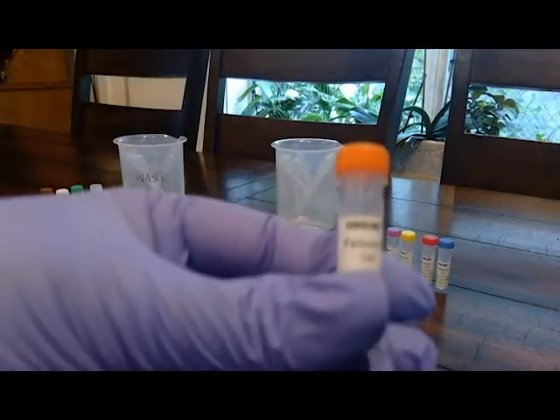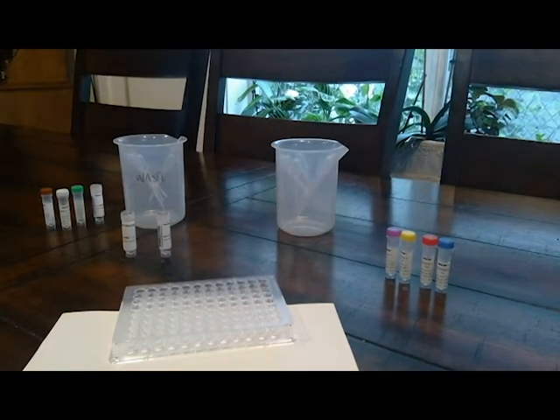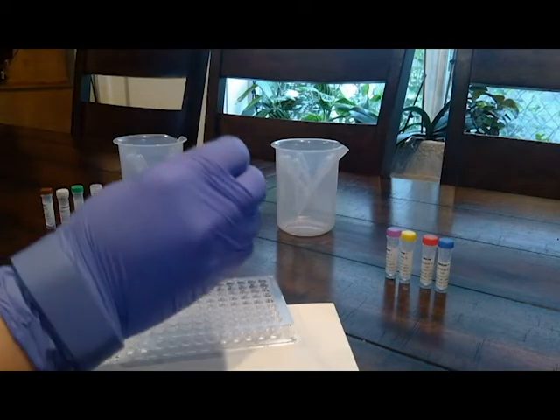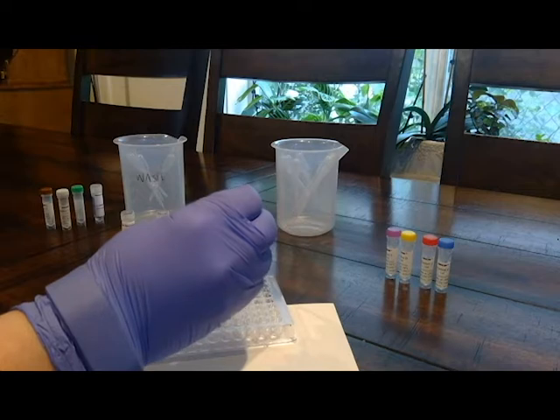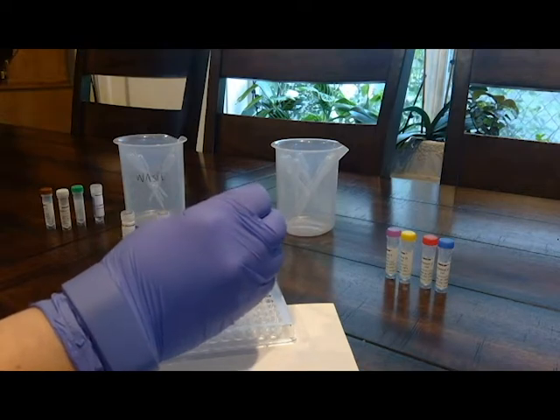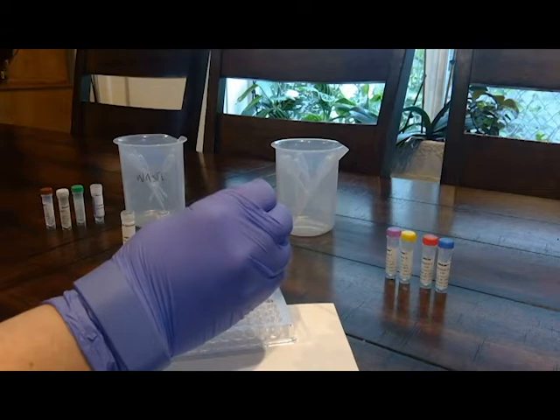So patient B to A10, 11, and 12. 1, 2, 3, 1, 2, 3, 1, 2, 3.